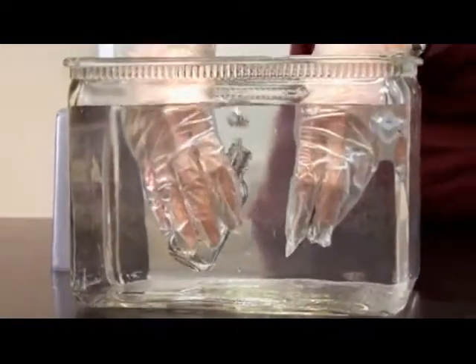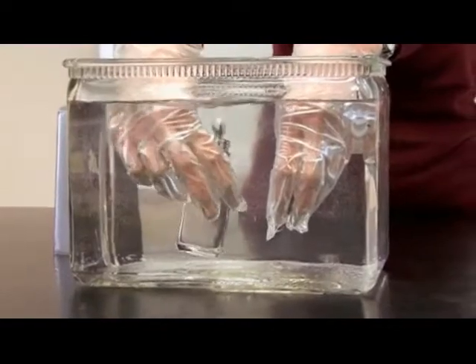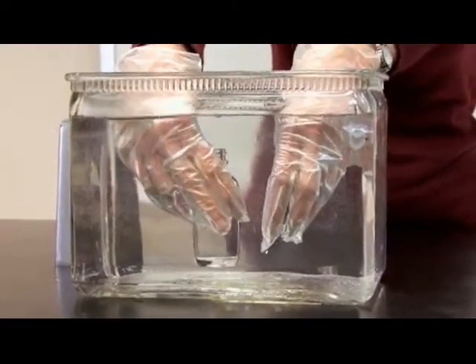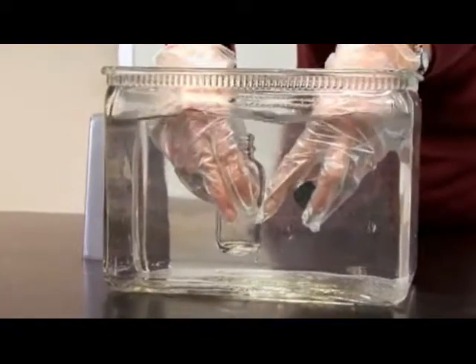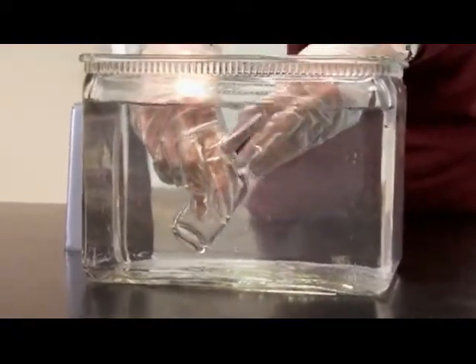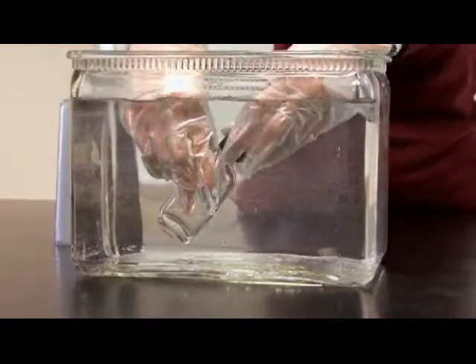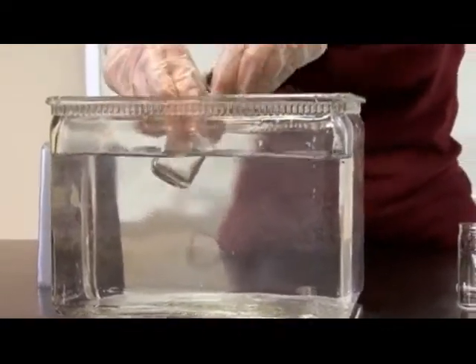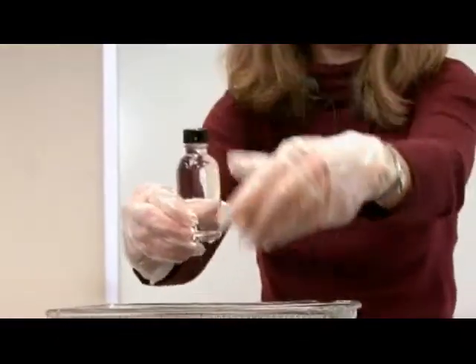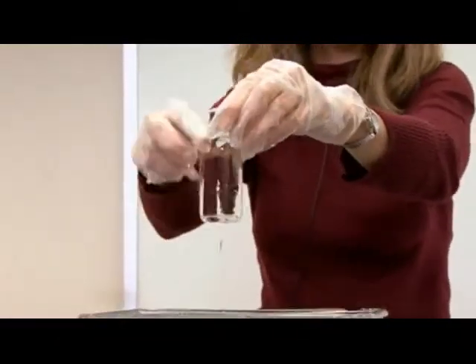Next you want to collect your water. You do that by placing the water bottle and the cap below the surface of the water. You want to tap the bottle gently to dislodge any air bubbles, and then actually place the cap onto the bottle while both the cap and the bottle are still below the surface of the water. This way you prevent getting any air bubbles into your sample, which would affect your results.